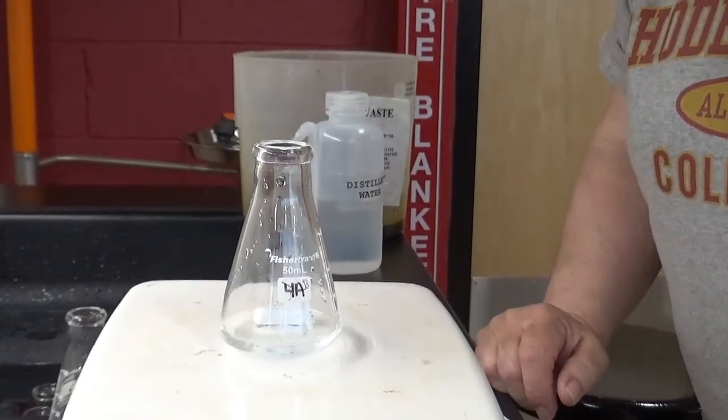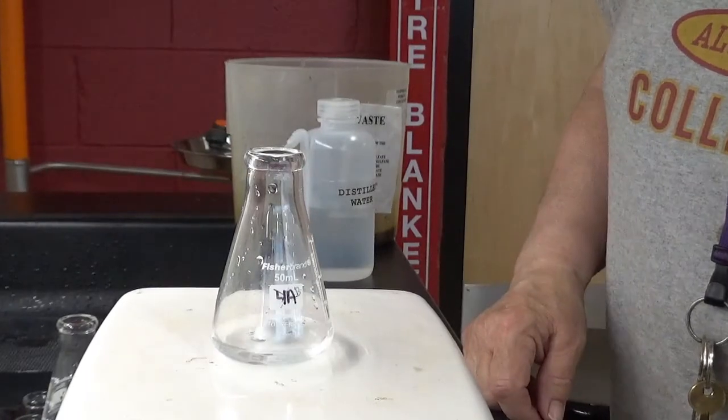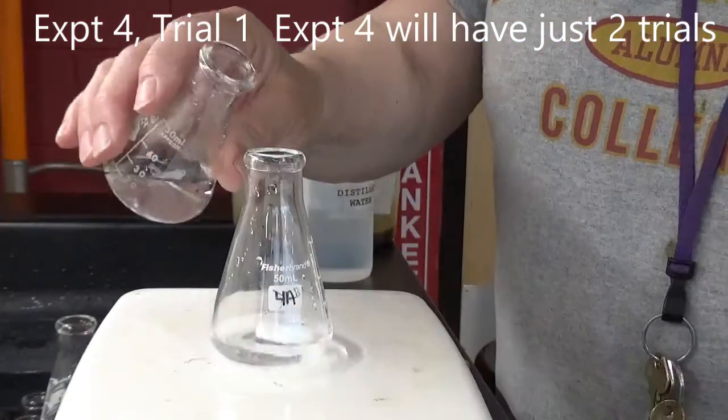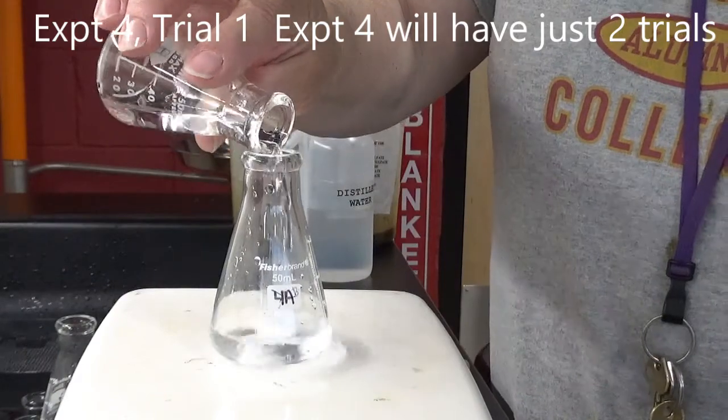This is experiment number 4. This is solution A.